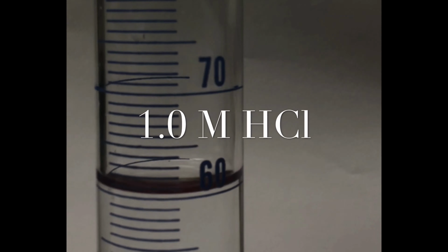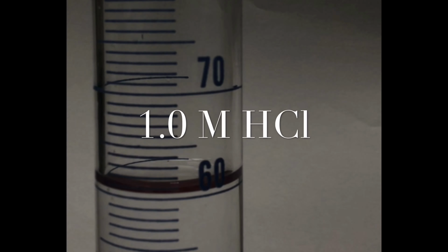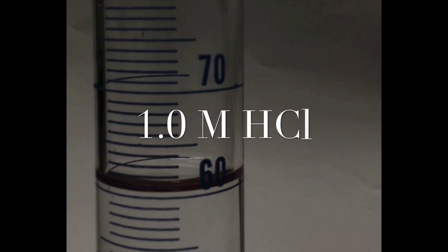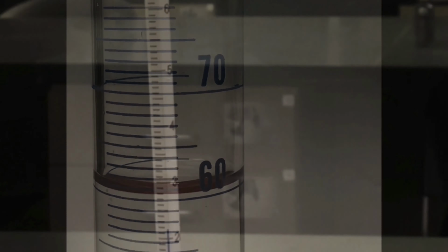Again, we will measure out 60 milliliters of a 1 molar hydrochloric acid solution and add it to the calorimeter. And then we will measure the initial temperature of the hydrochloric acid. Please pause the video and record the initial temperature of the hydrochloric acid.